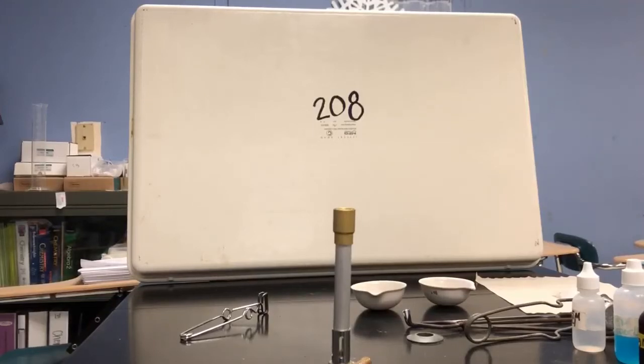This is our classifying chemical reactions, analyzing and predicting products lab. There are kind of 7 separate experiments in this lab, and so I'll go through each one, not necessarily in the exact order because some reactions take longer than others. And so we're going to start with reaction 4 first. From experience, I know this one takes a bit more time.